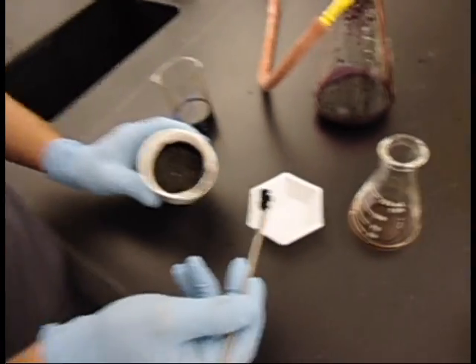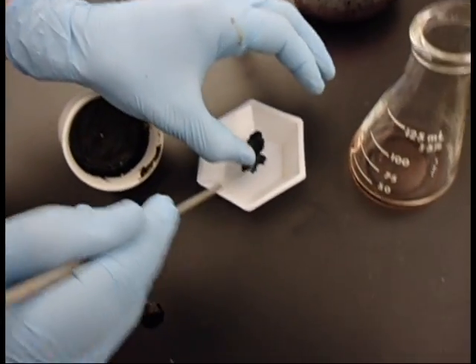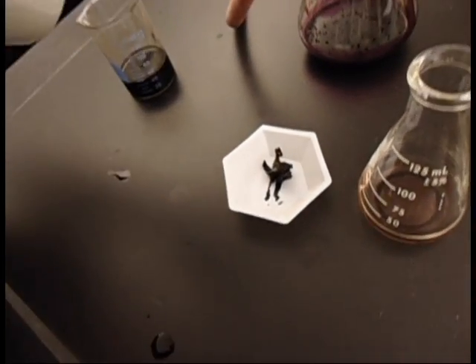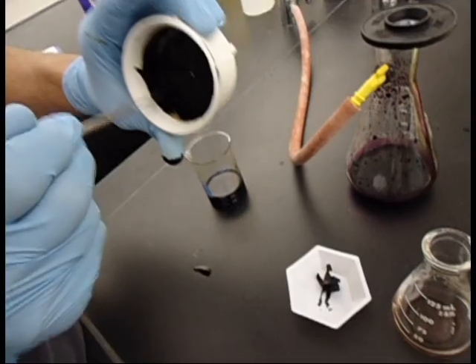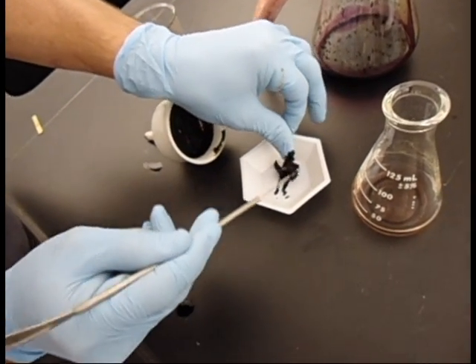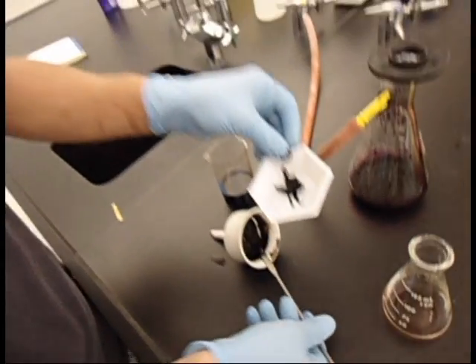We're scraping out the filtered product, which is the dye, and we're going to weigh it out. After that is the drying process, and we're pretty much done.